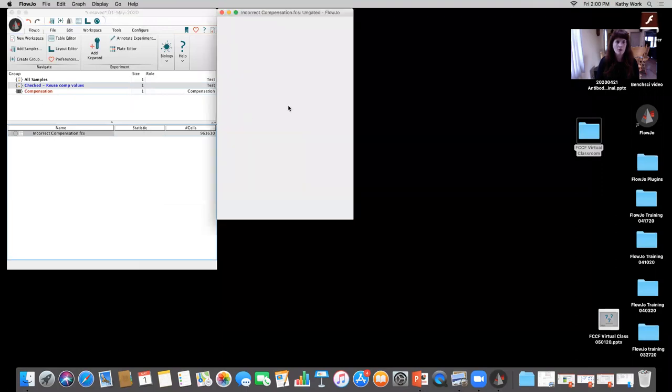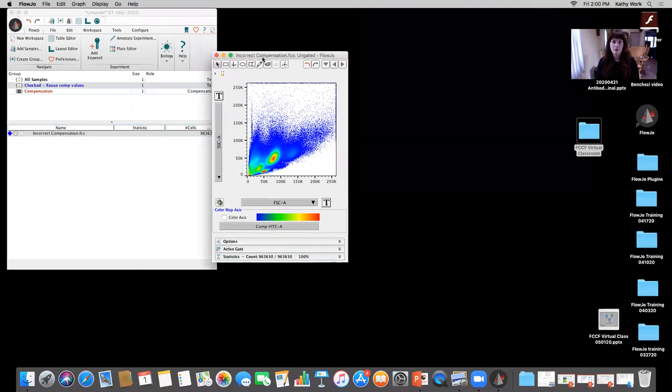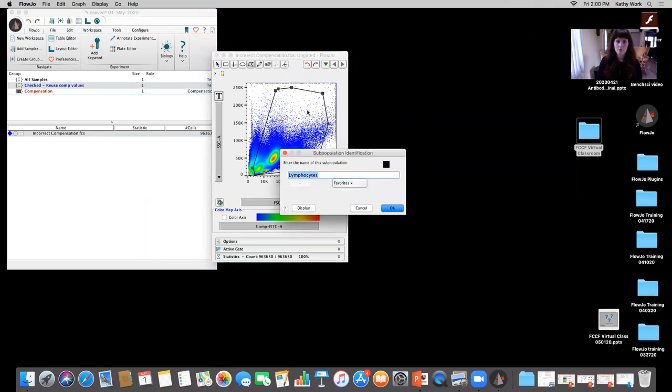So I'm going to do the gating as they would have done for that experiment. What they did first was take a look at scatter. There are a couple of different populations here, and it's hard to tell what's what. So I'll try to exclude what I believe is debris. There is a viability gating in this one that we're going to check out. I'm going to call that scatter.